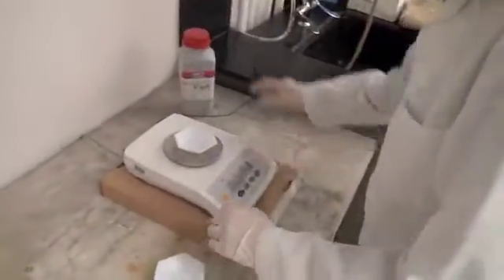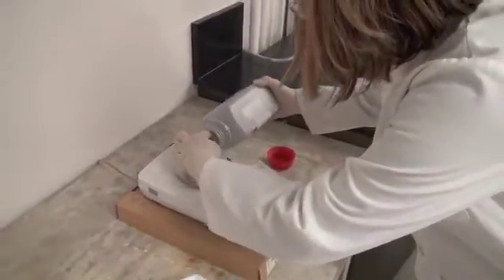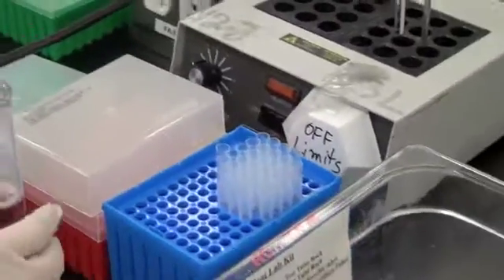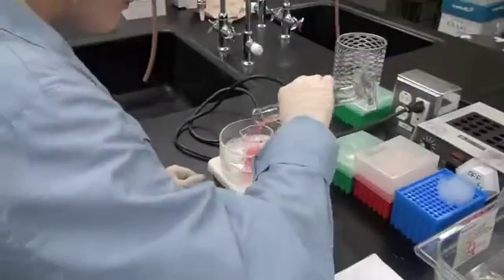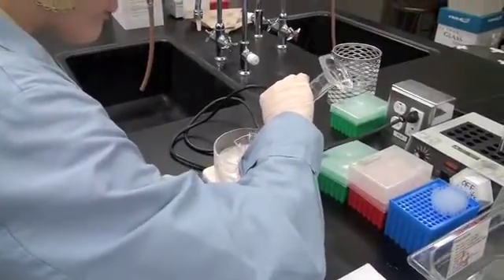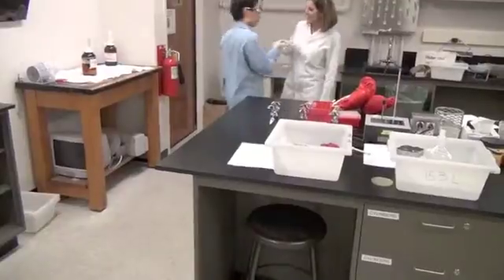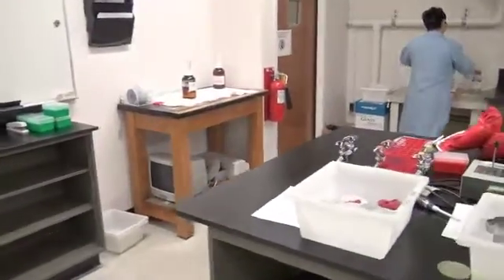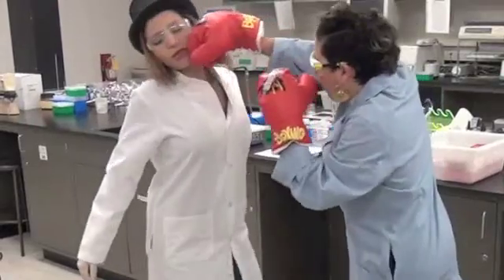Oh, is Challenger Kurate starting over with the 40%? She could try to resuspend her 40% pellet and repeat the 40% salt addition, but with all her errors, that could have led to complete loss of activity. She may need to make a new crude extract and start from the beginning. Well, with Challenger Kurate having to repeat this step, and with such a bleak potential outcome, it is clear that Biochemist Dicer has delivered another knockout punch.